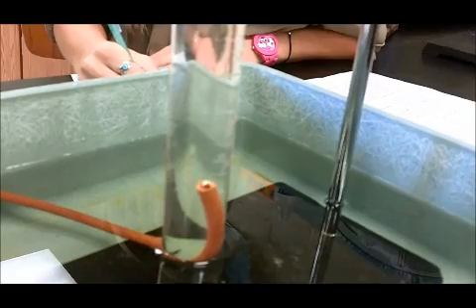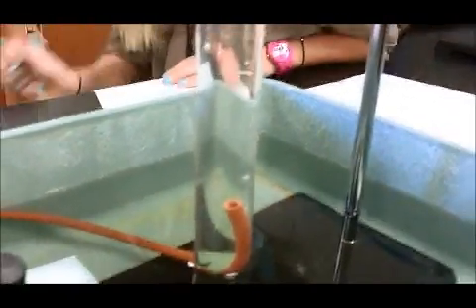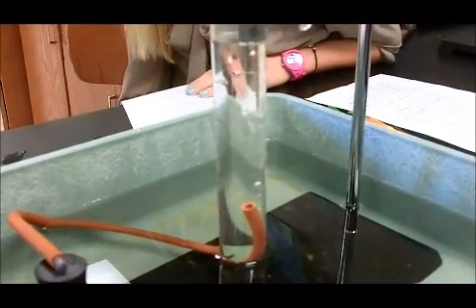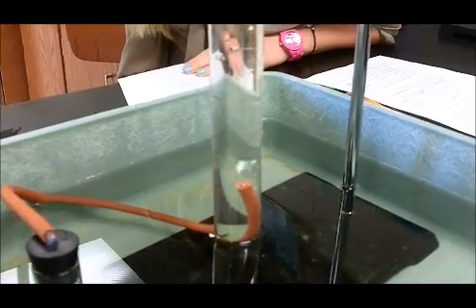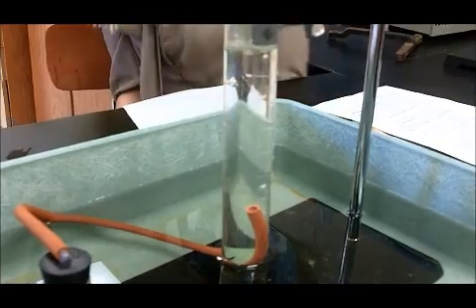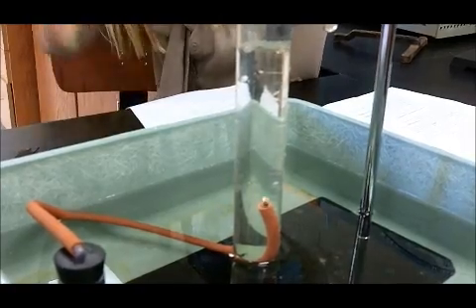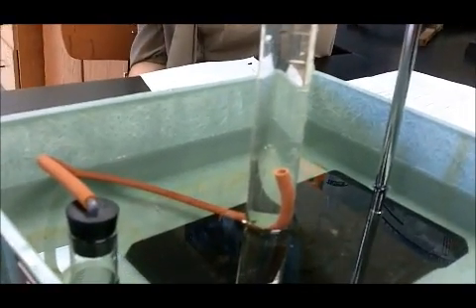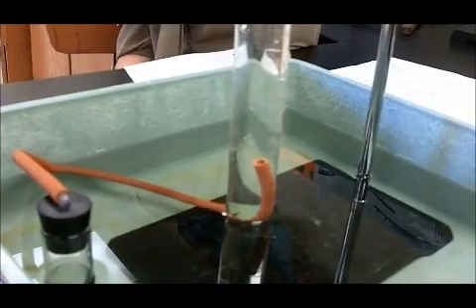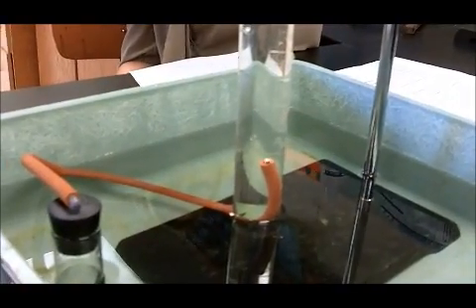Students are recording data and notice an unexpected result — a half concentration seems to be going faster than three quarters. They discuss a possible explanation: maybe the yeast wasn't mixed well in the flask, so all the yeast settled on the bottom, and they grabbed from the top with very little yeast.